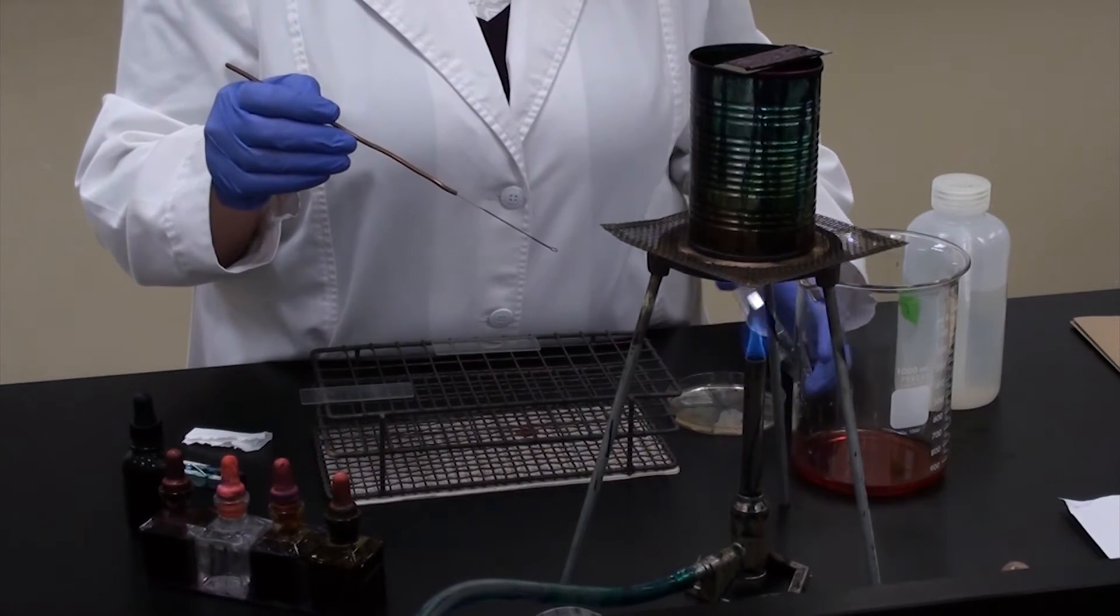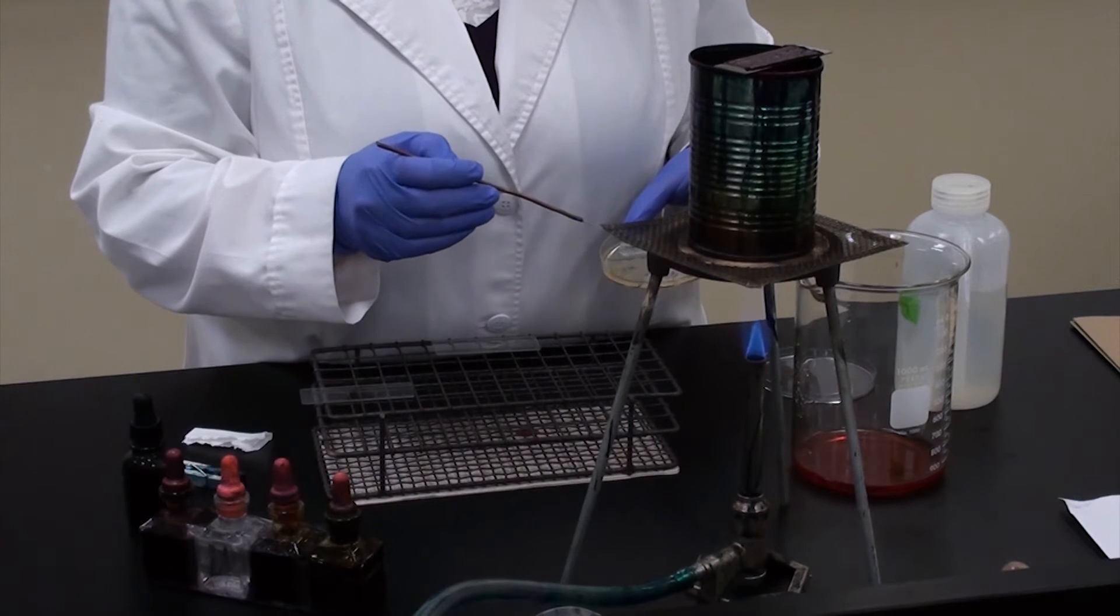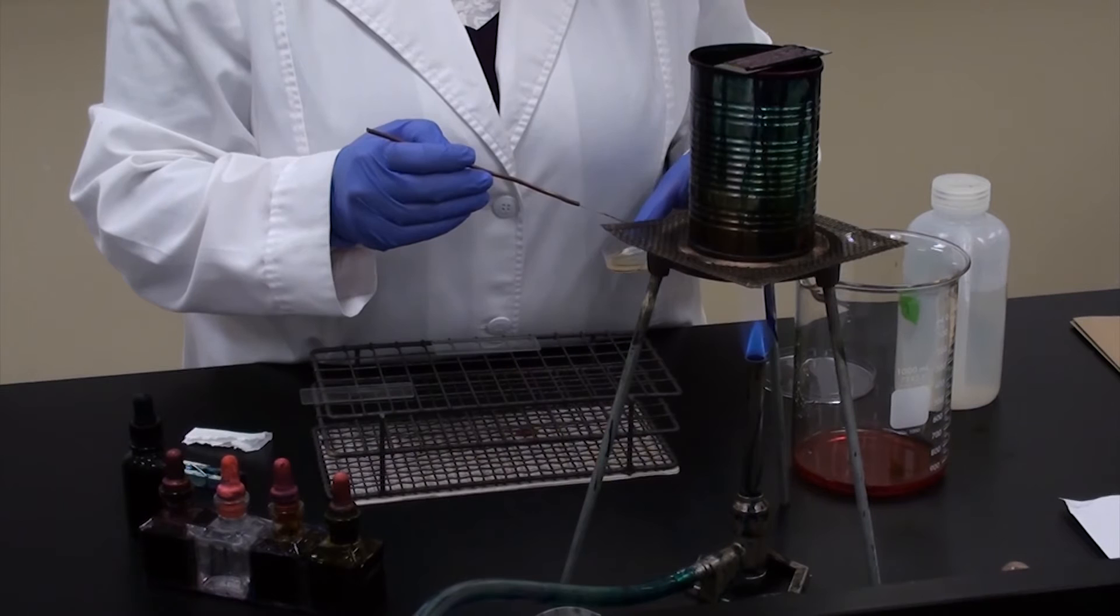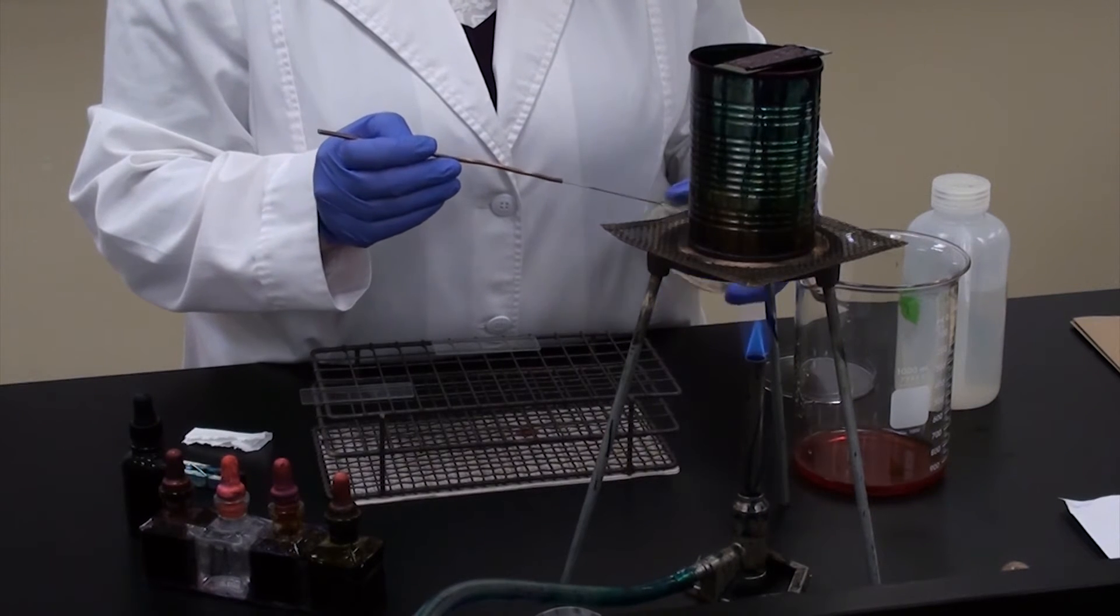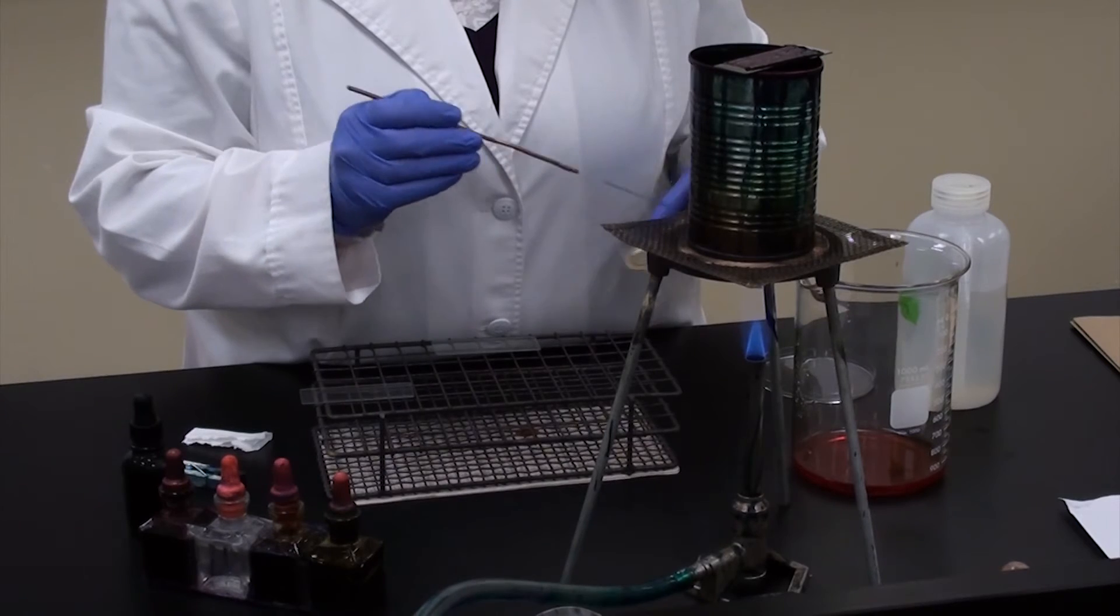I should be ready to go. As Brendan demonstrated, if you're unsure, you can always touch it to the gel, and if you hear a sizzling sound, it's not quite cool yet. For this particular organism, I'm going to transfer over Bacillus subtilis because I know it's a nice endospore producer.